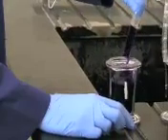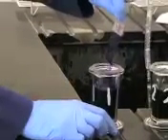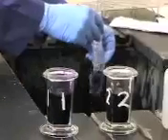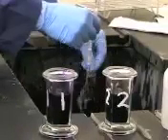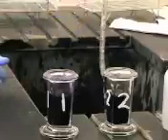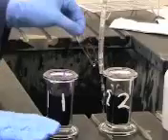Since we're using the pharmacy school's wonderful lab, we don't want to get them messy. So make sure that you get any excess off. And then what you're going to do is grab the slide and stick it under the water and rinse off both sides of the slide. After that, hold the white part and give it a little flick to get some excess water off. Don't dry it though. You just want to flick it a little bit, no towels.